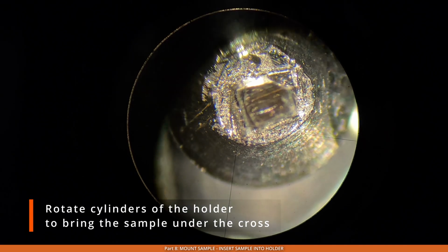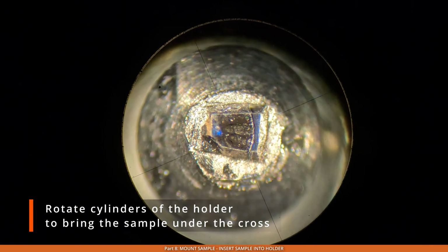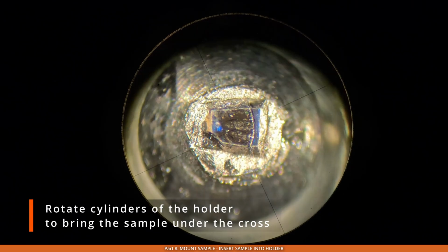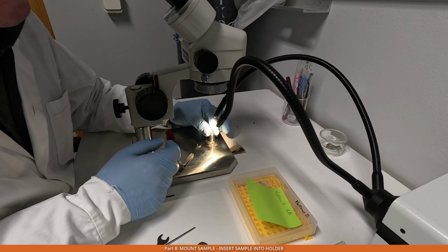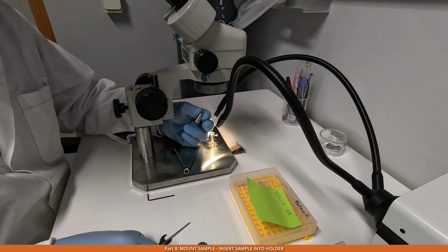So that's how the sample looked like when I put it in. Now I rotated the view and aligned the sample so that the center of it is approximately at the center of the cross.